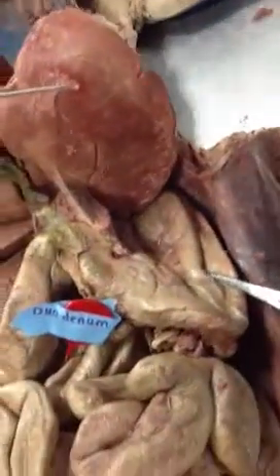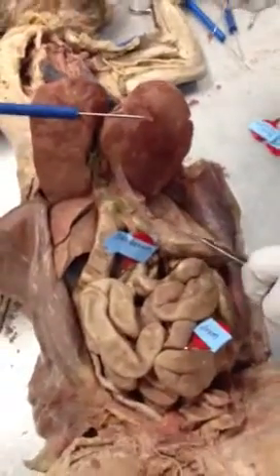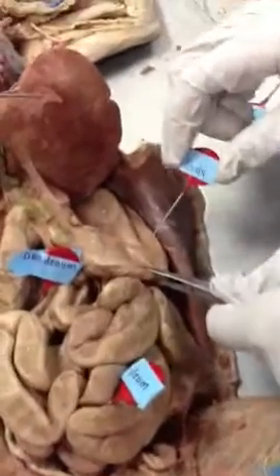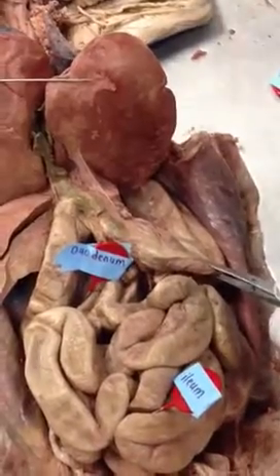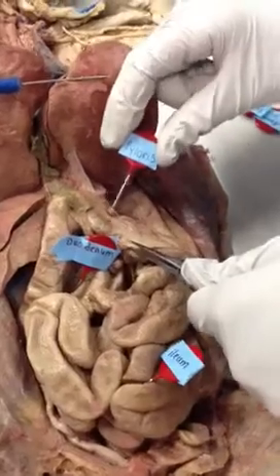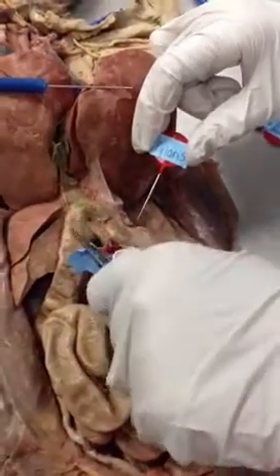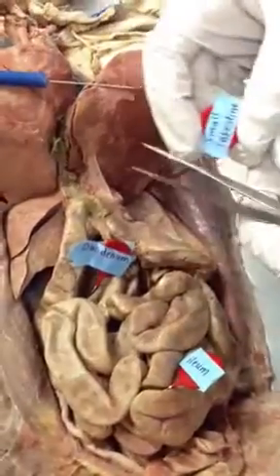The body, which I don't think we have a sticker for. The body is the main portion of the stomach in the middle. That's right here. Then, as the body gets thinner, it thins out and becomes the pylorus, which is right here, this thin spot. Once the food passes from the pylorus into the duodenum through the pyloric sphincter, we hit the small intestines.